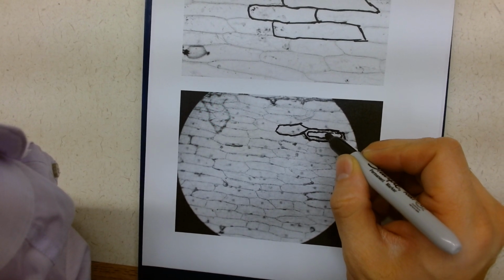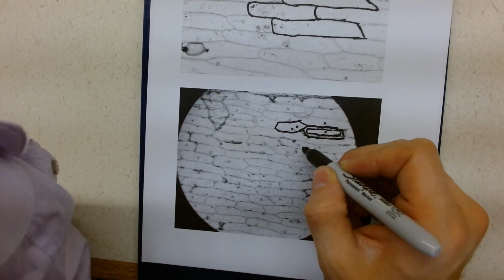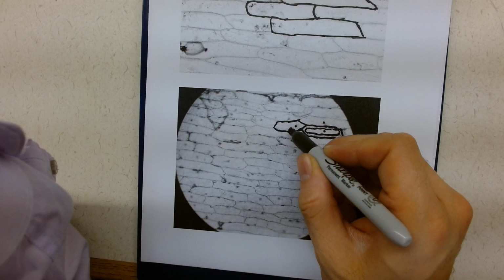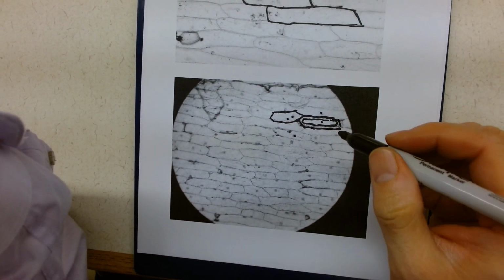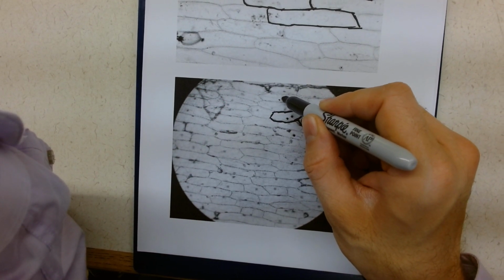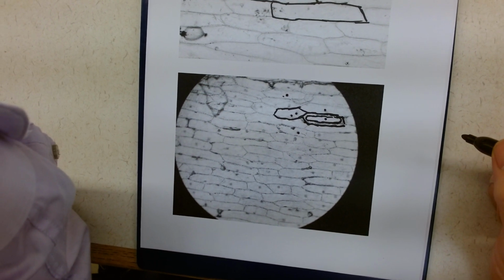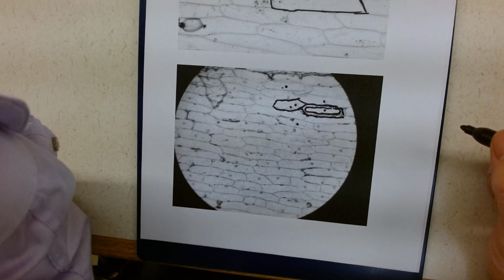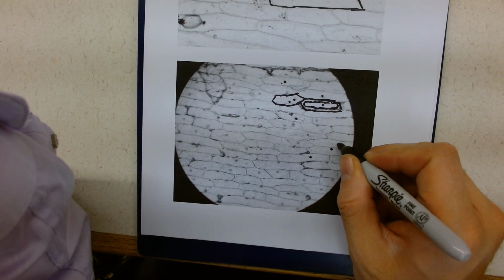And then inside you could see one, maybe two dots. I think that the two dots probably mean that there's a different organelle being shown, but you can see the largest, thickest dot is going to be the nucleus. The nucleus is able to absorb the iodine to a greater degree than any other organelle.